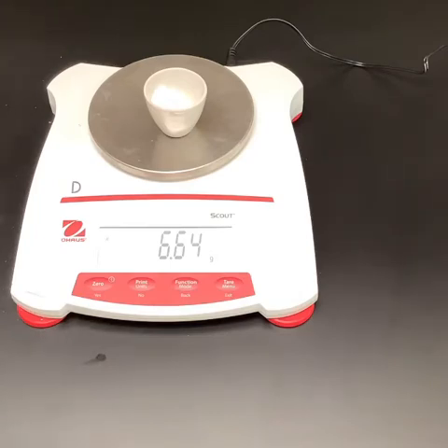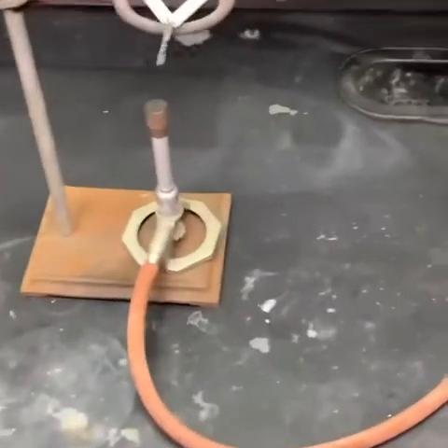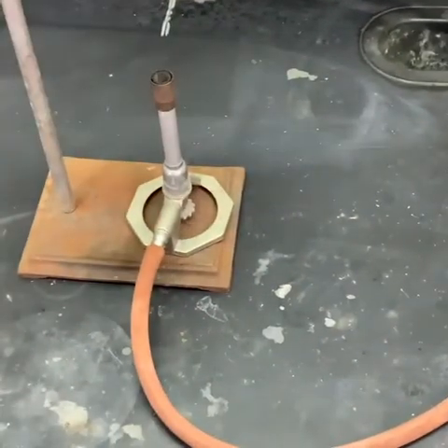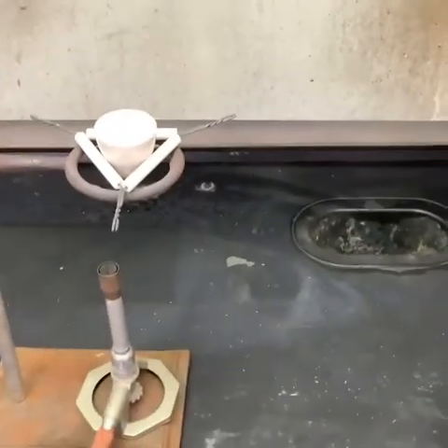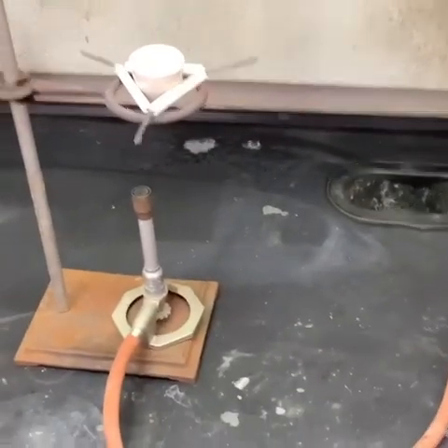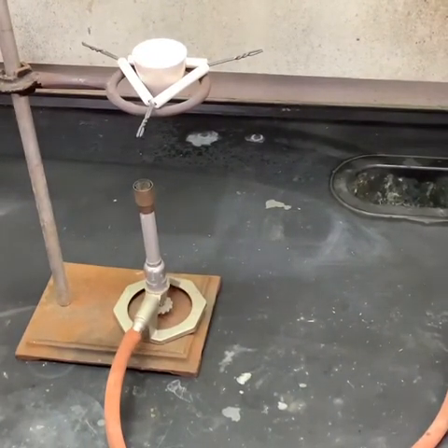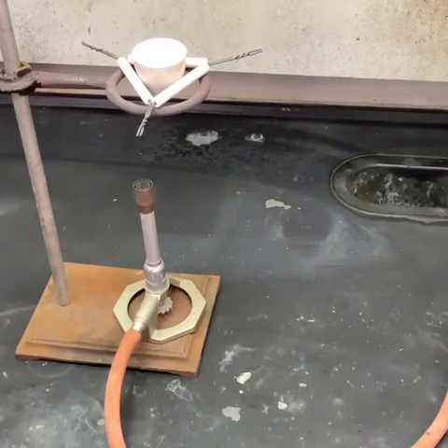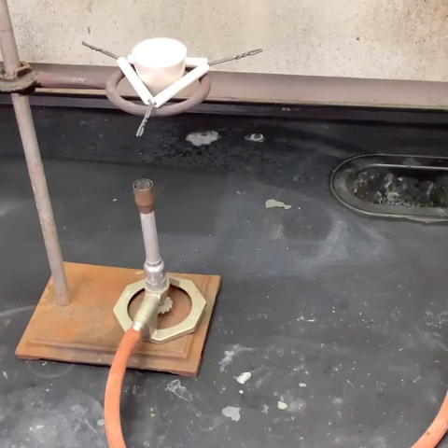And now what we want to do is basically put it in the oven like we would if we were cooking. So we're going to go ahead and take our sample, and we're going to move over to the fume hood here and cook our sample. I'm not going to make you guys sit here for the whole cook. I tend to save you a little bit of that. There's not really a lot of anything exciting to see in this process. If you look at some of those products that we're making, they are basically stuff that we can't see.